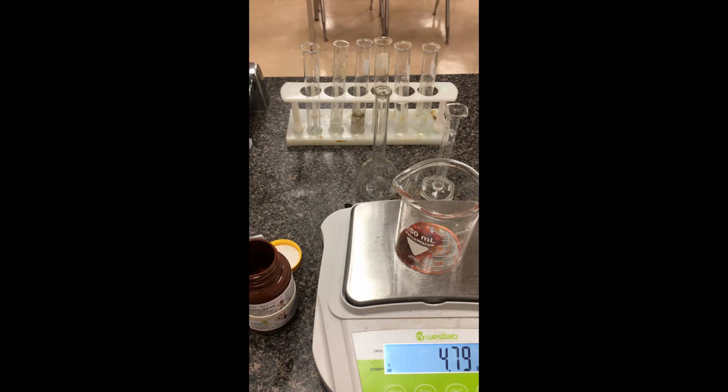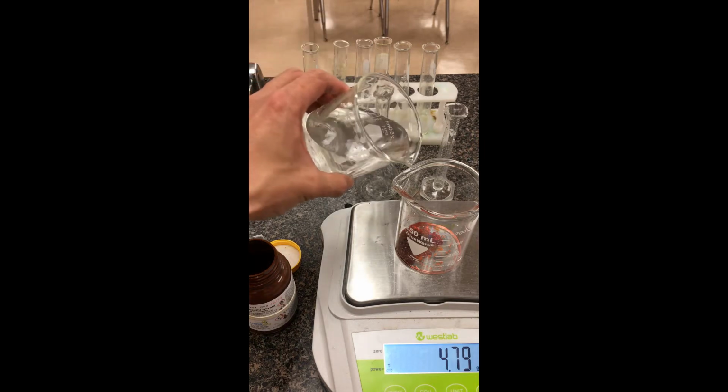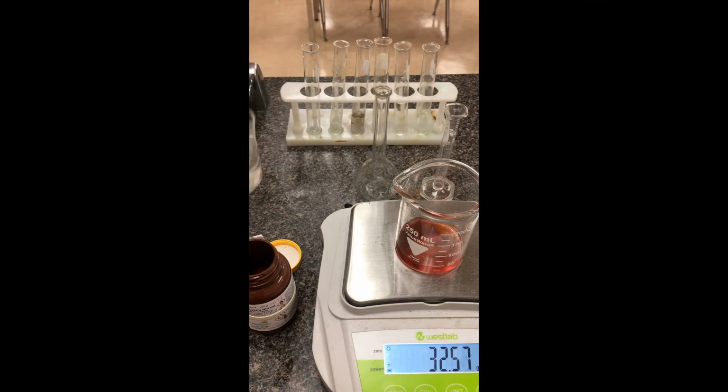Again, what we want to do is make a solution of this inside a volumetric flask. We have a 100 milliliter volumetric flask there. Unfortunately, because of the narrow neck, it's really hard to dissolve powder in there. So as I add water, I'm just going to add water to the beaker first. Just make sure it is under 100. We're going to eventually put it in the volumetric here, transfer some rinsings back into the volumetric, and then make it up to the mark later on.